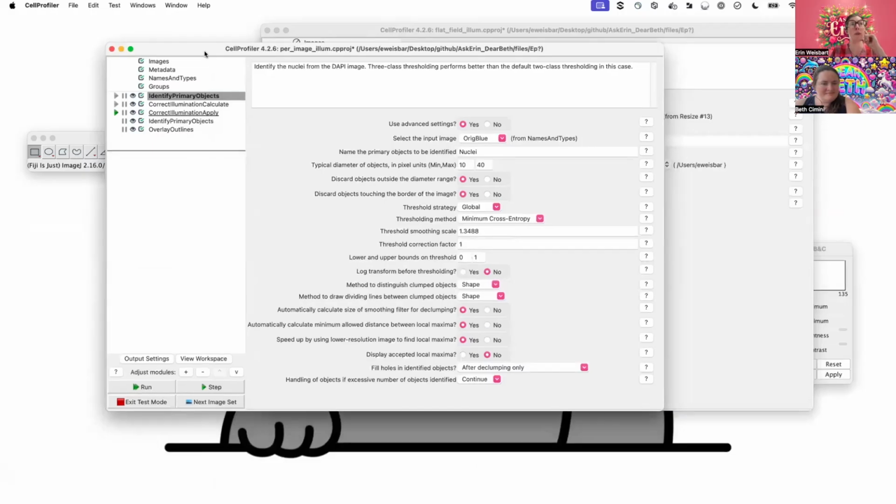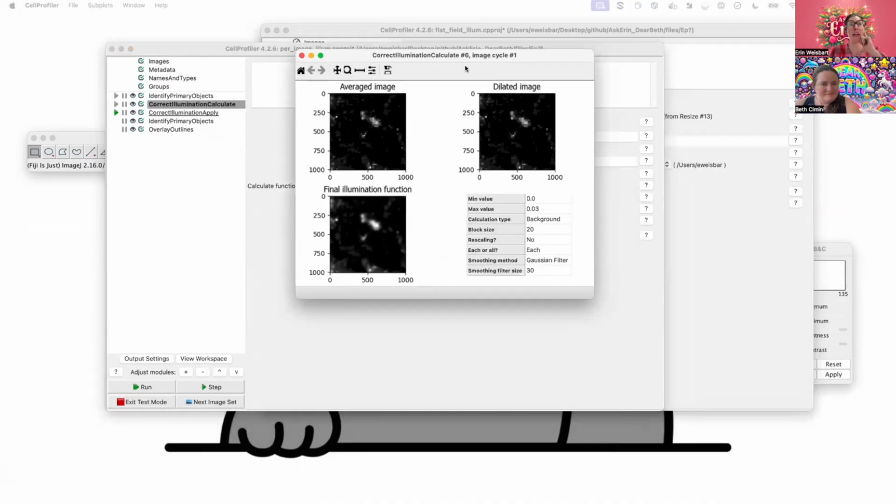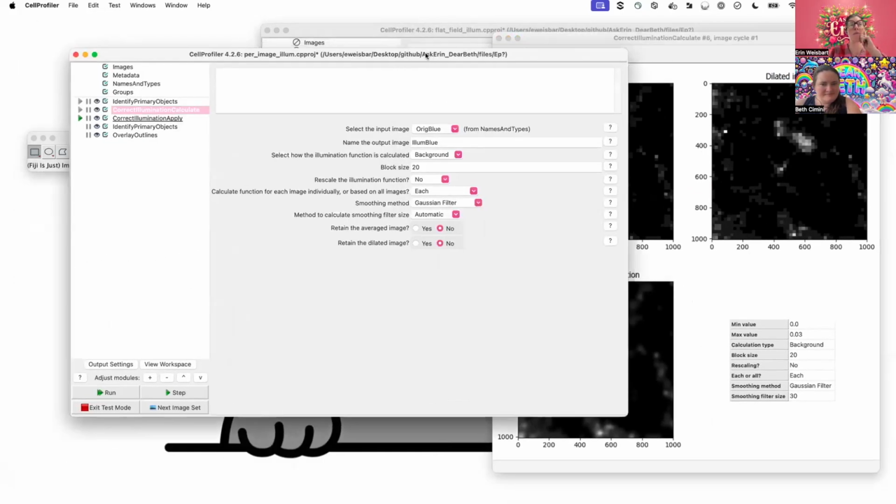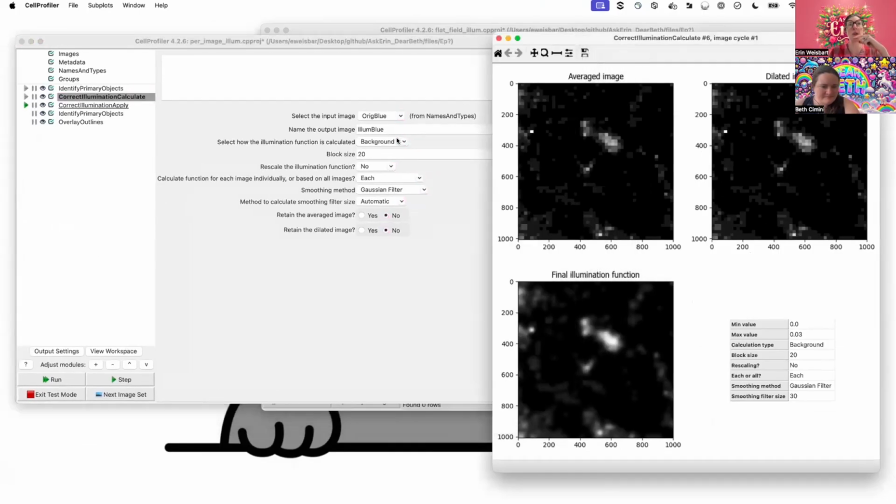So one thing that we can do is a Correct Illumination Calculate and then apply. So what I have set here, what is different from the other example I gave: illumination function, this is background, an important setting there. And here I have set a block size, and I'll show you a couple different examples of how that affects this. But this is just empirically, at what scale do I want to take areas of brightness that perhaps are then bleeding into their pixels nearby and subtract that out so that we get a crisper image, particularly in the bright regions.